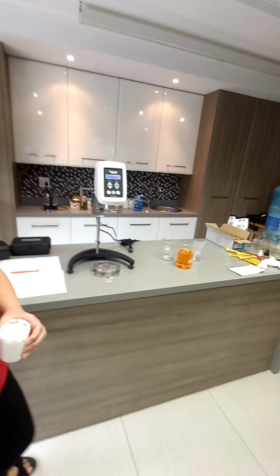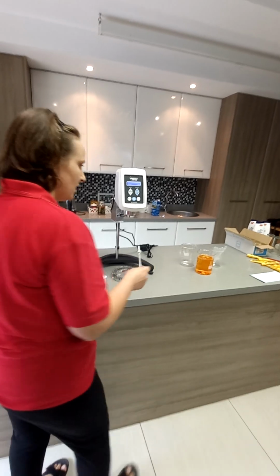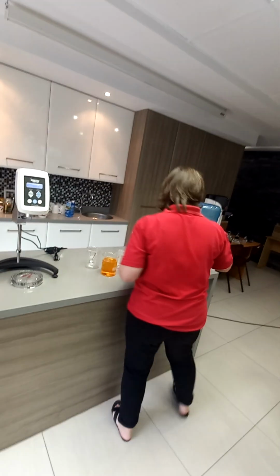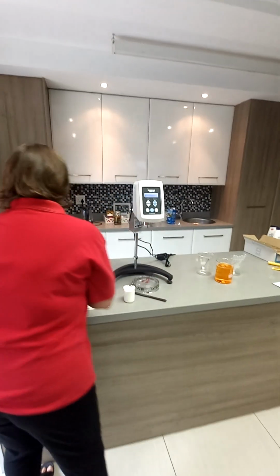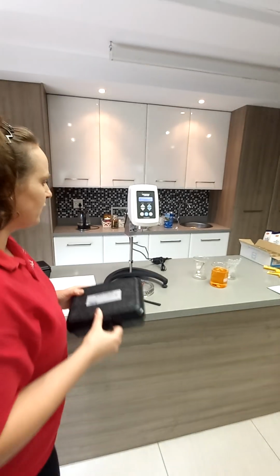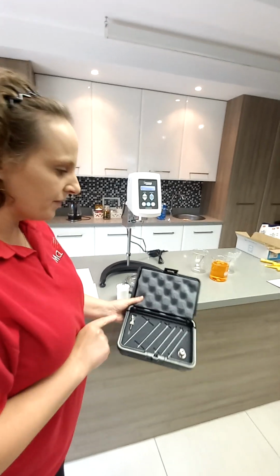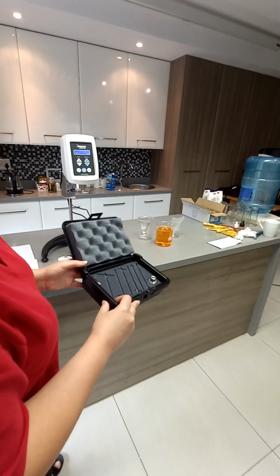Sunscreen. It's quite a thick sunscreen. It's not even in a sprayable, it's a tube. So for sunscreens, because you can't use the normal spindle because it's non-flowing and it makes a hole, there's what Brookfield calls a helipath accessory.